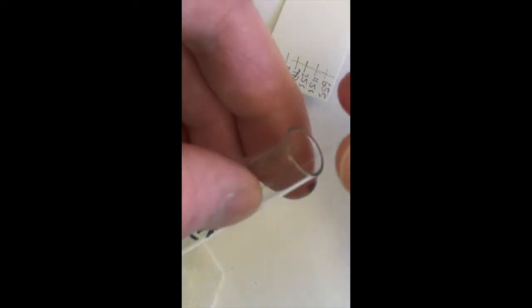Okay, stick my capillary tube down in there, get the solution out, and first drain most of it onto a paper towel, and then I'll spot that at x0. There we go. All right, so a bumpy road, but it's going to work.